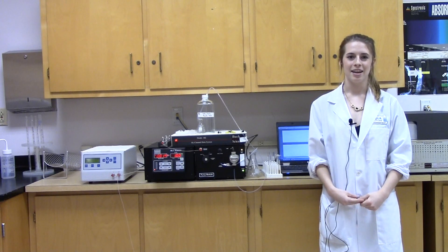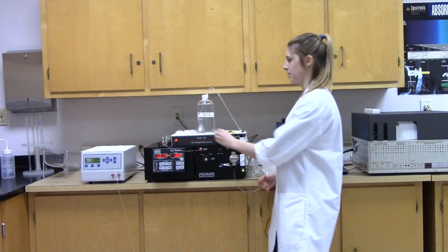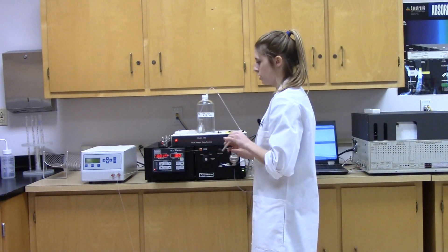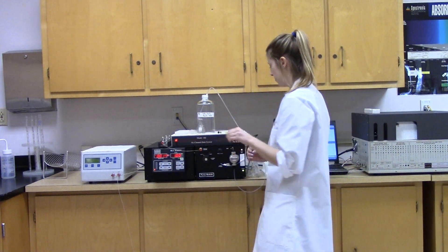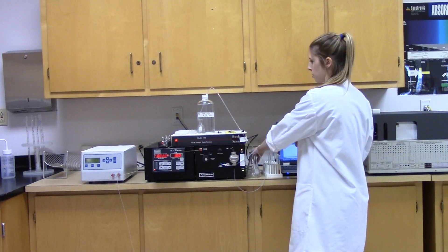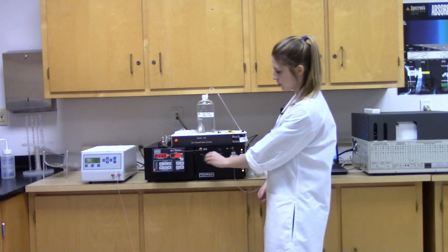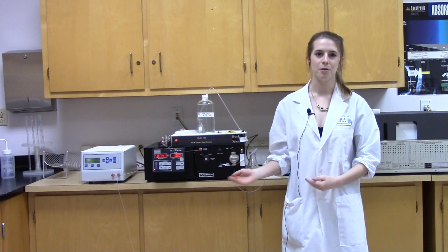This scan is going to take anywhere between two to five minutes, while we wait for the main peak to come out. During this time, you can take the syringe used to inject the pure caffeine into the sample, and rinse it out with the mobile phase. After about five minutes, it's very important you switch this back to the load position, so you're ready for the next sample.